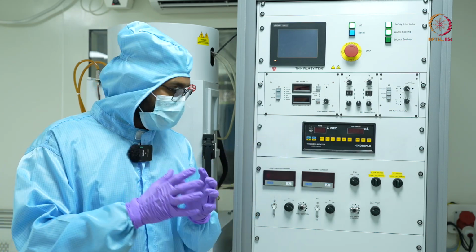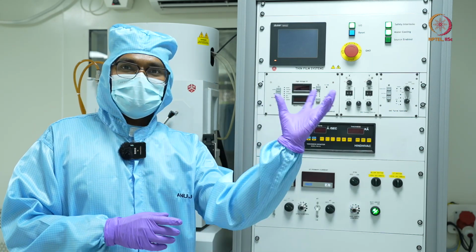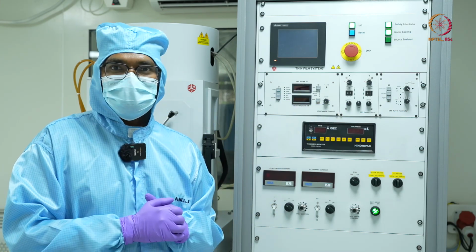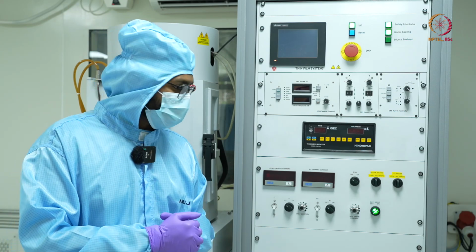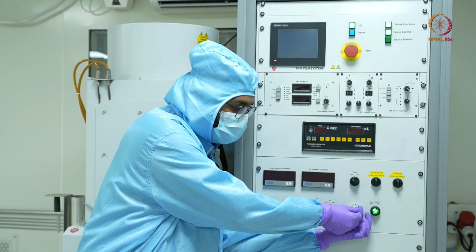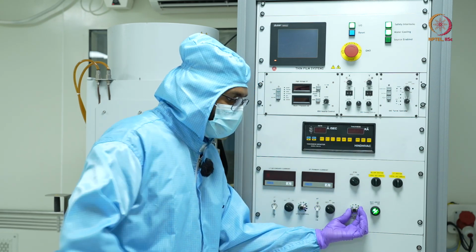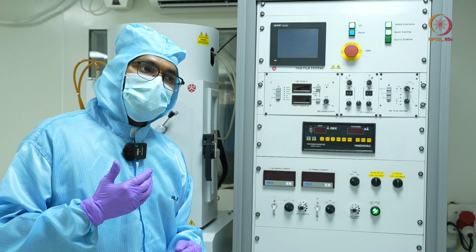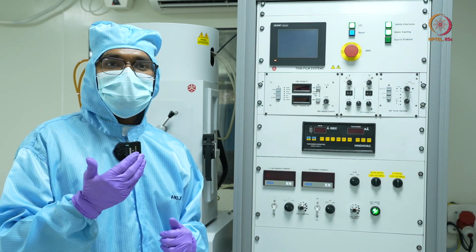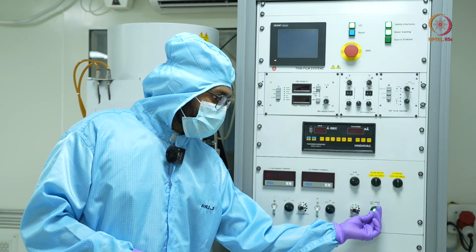So what I'll do is use this option of a rotary drive. My substrate holder starts rotating, and this ensures that there is a uniform deposition for whatever time I am depositing. Here I have this knob using which I can control the speed of the rotation. Right now I have kept it at 3 RPM, but depending upon my requirements, I can go up to 5 RPM or even less, 1 RPM. Okay, I'll stop it again.